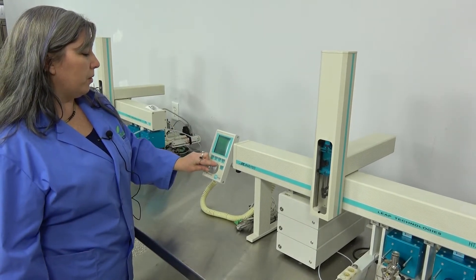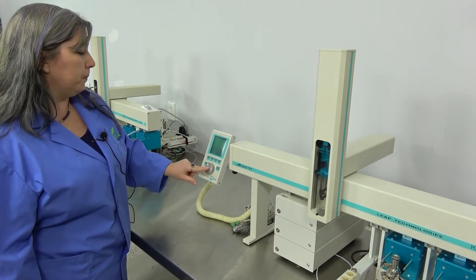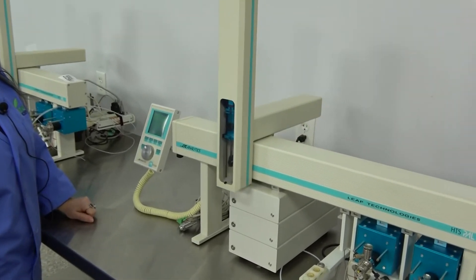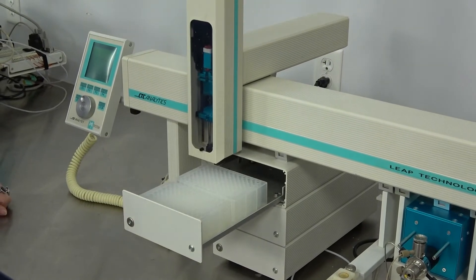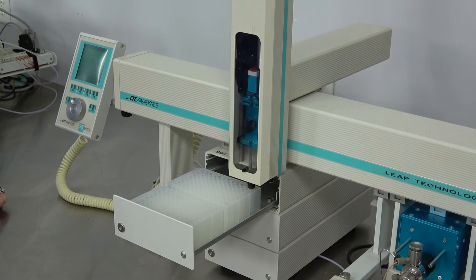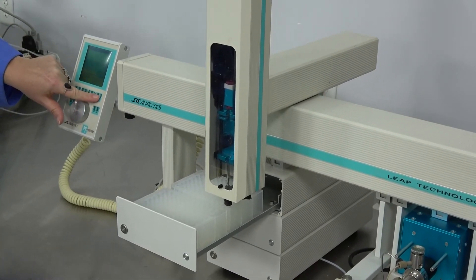We have pre-programmed in a few. So we're just going to tell it to go to tray number two in drawer number one. There is no syringe in it right now just for safety. It will automatically go to the number one spot. We can also tell it to go to the number 12 spot, then to number 96. I'm going to go ahead and tell it to go home.